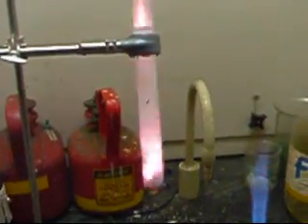And now we drop in the gummy bears. Oh, I can smell it! Oh my gosh! That is a combustion reaction, and again our fuel was the sugar in that case.